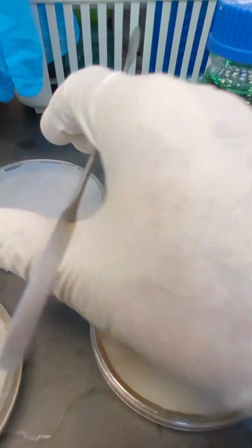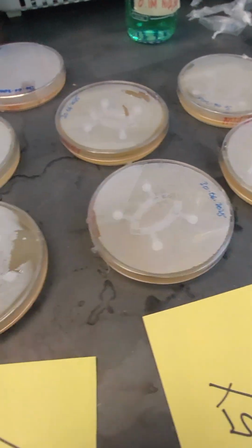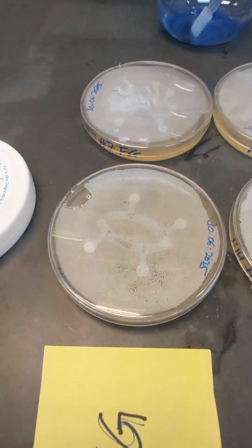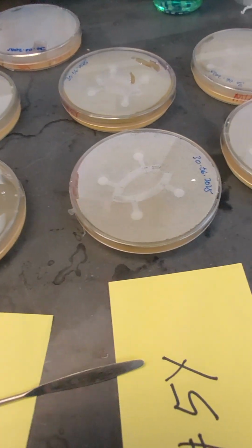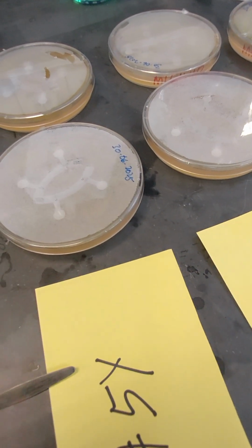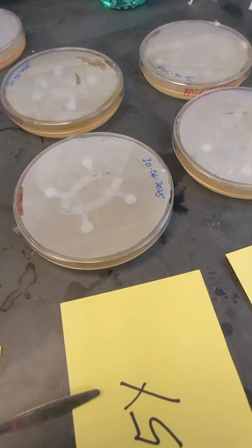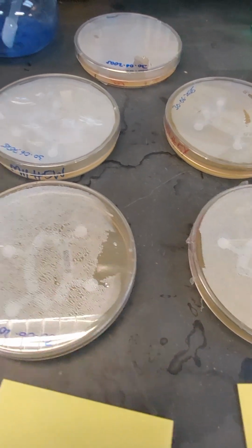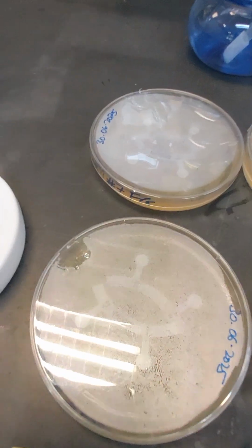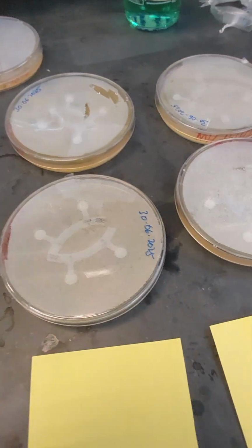Now all of these results show something very interesting regarding the antibiotic profile. And as microbiologists, we look at the antibiotic resistance profile both in terms of the clinical implications of that particular assay as well as the implications for the genetics and the production of antimicrobials. Certain microbes can be harnessed for the production of antimicrobials against other microbes. So this is a medical opportunity.